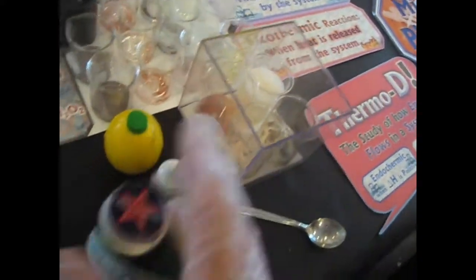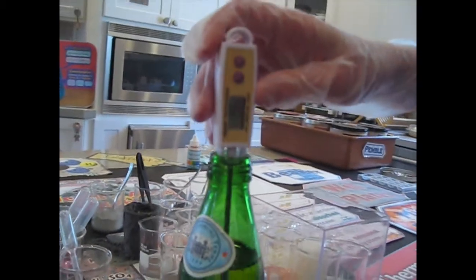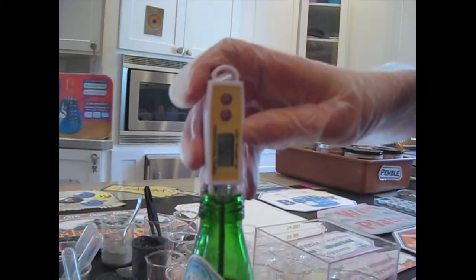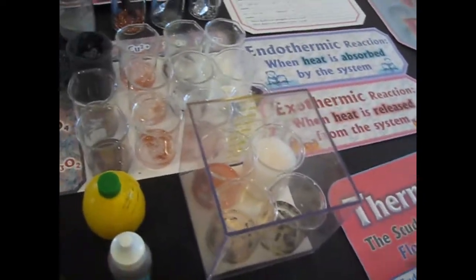We'll ruin this Pellegrino. Let's get the initial temperature. Stick it right in there. We won't drink it. Just get the temperature. I wonder what the Pellegrino started at. What did it start at? Do you see what's on there? Yeah, 19.6. Okay, so if it started at 19.6, then we have those other temperatures that it changed to.